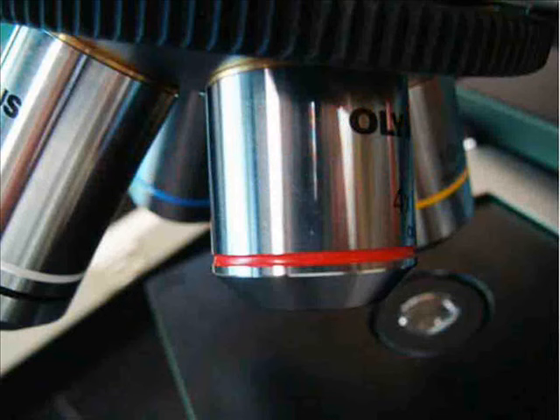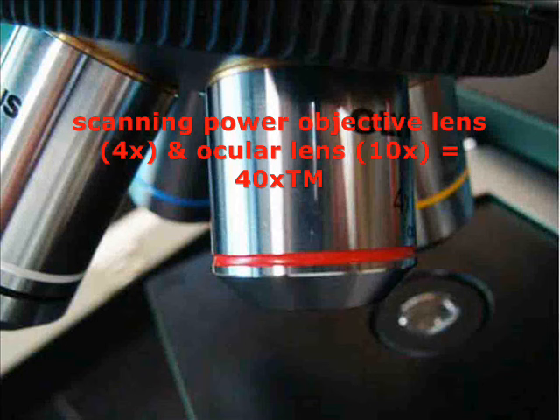However, since I'm always looking through both the ocular and the objective to view my specimen, I multiply the powers together to get my total magnification. So the ocular magnifies ten times, the scanning magnifies four times, meaning at scanning power my total magnification is 40 times actual size.